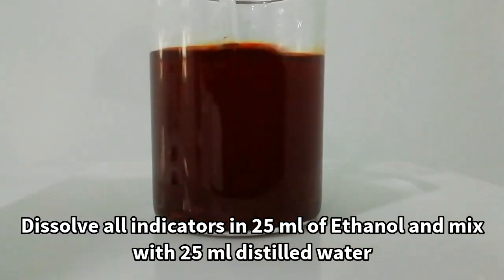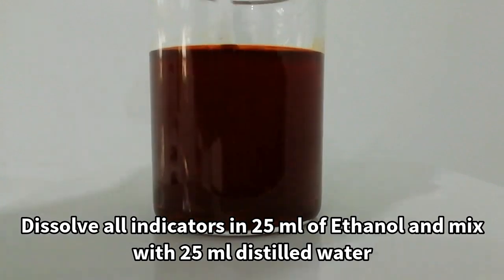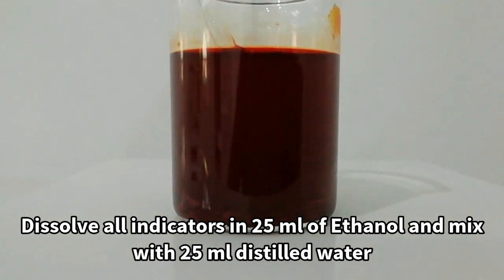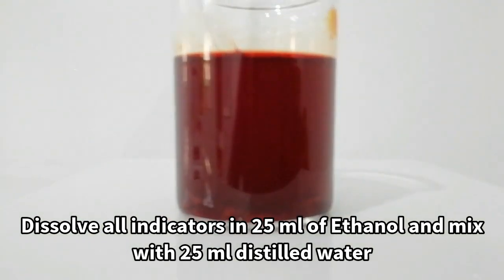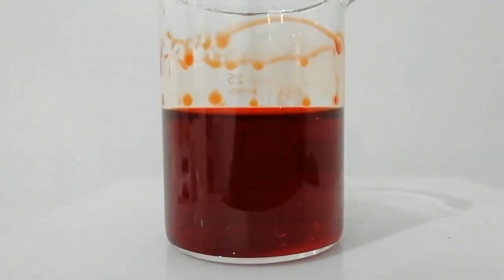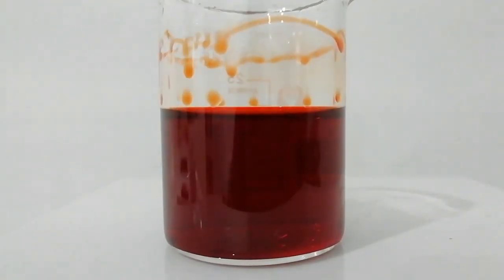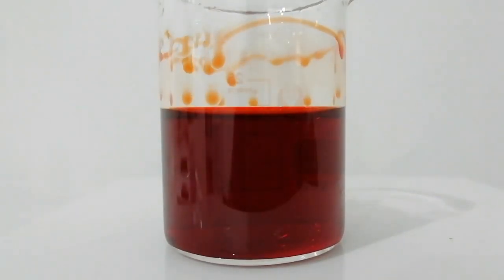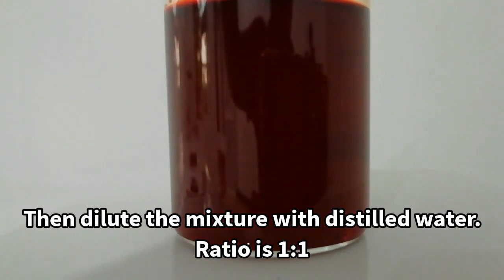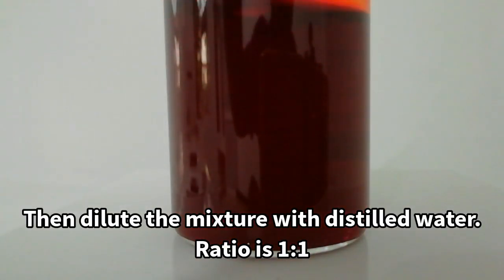First, all indicators were mixed together and 25 ml of ethanol was added. After dissolving all indicators in ethanol, the solution was added to 25 ml of distilled water.